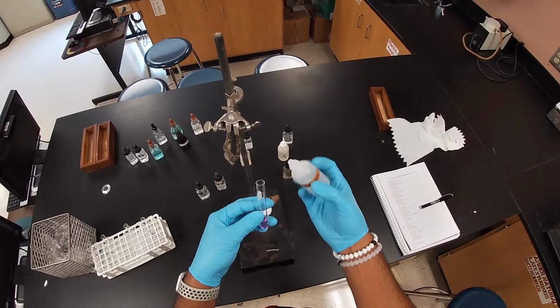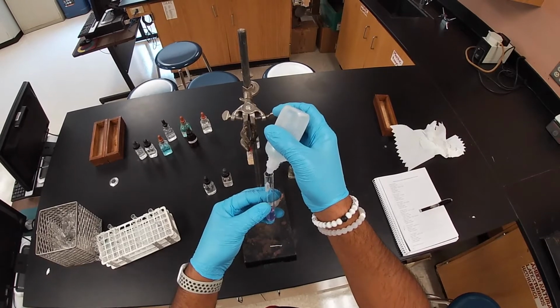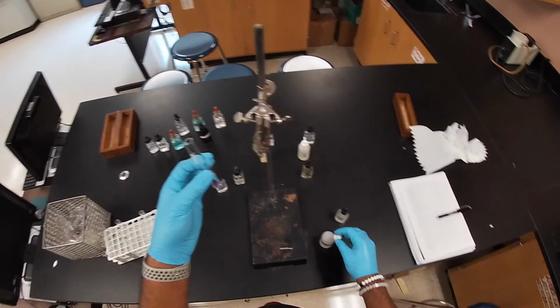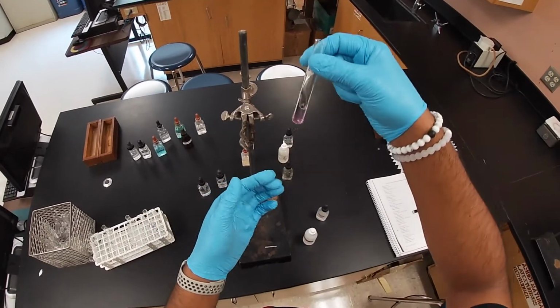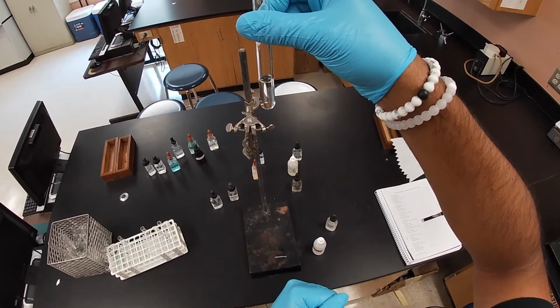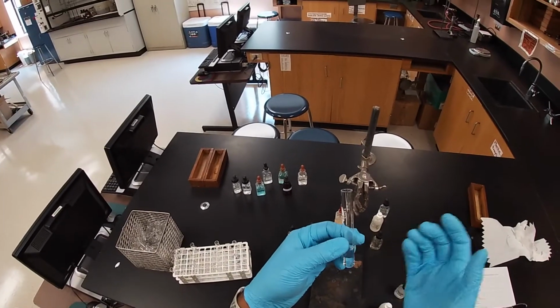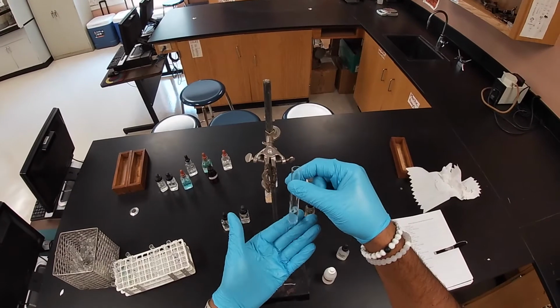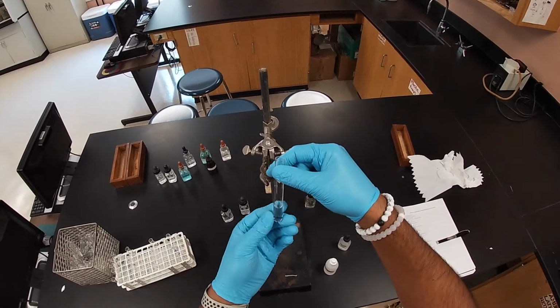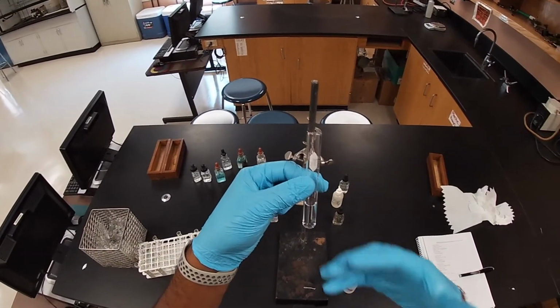Okay, so let's go ahead and see if we add some acid here. That hint of pink goes away. And as you can see, as I'm adding a little bit of the acid again, we break that equilibrium, and there is no more pink solution. But if I add the sodium hydroxide, you'll start getting some pink until it completely gets that phenolphthalein out. But as far as observation goes, we really can't see anything.